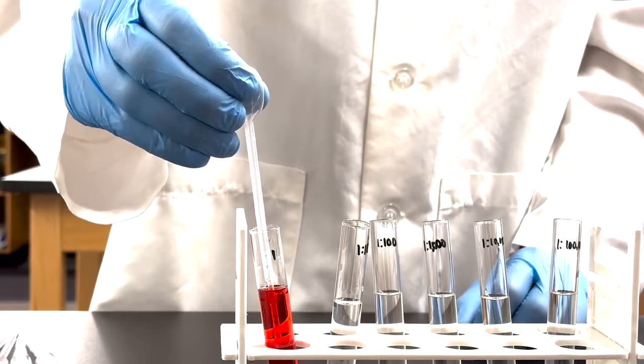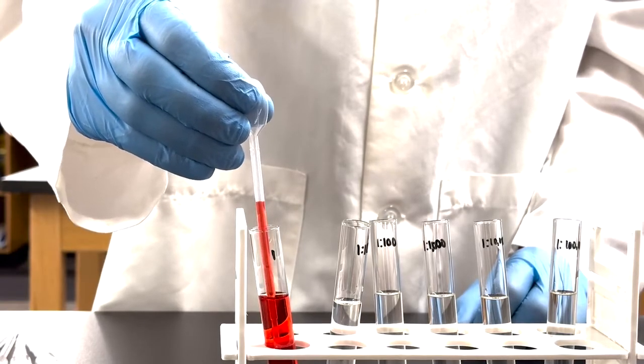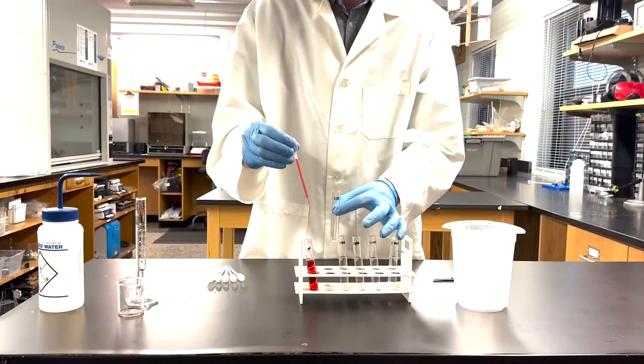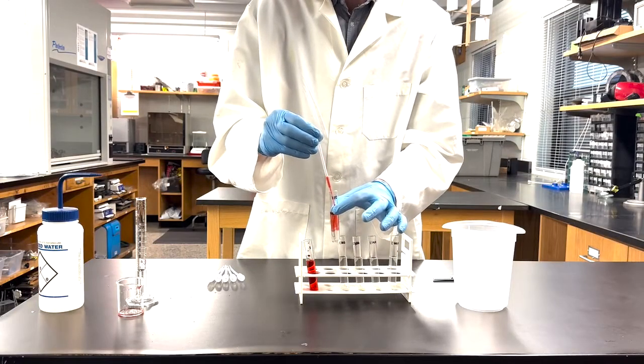From the stock solution, withdraw 1 mL and add it to the first tube. Mix the solution by pipetting up and down.